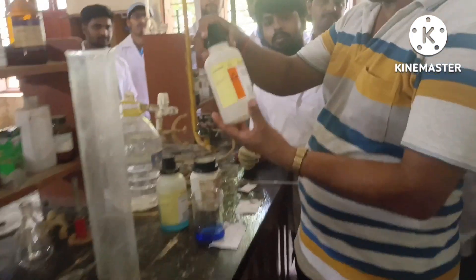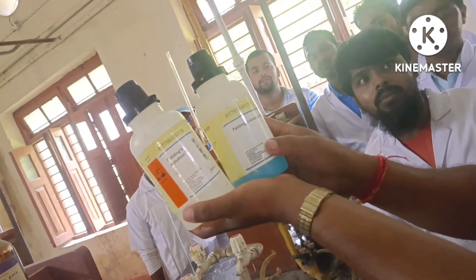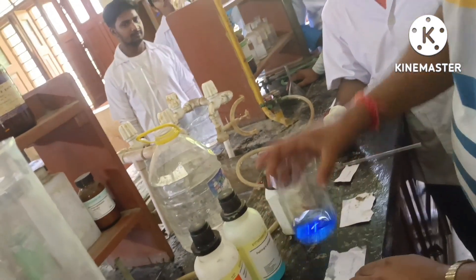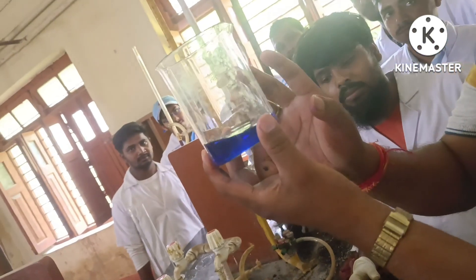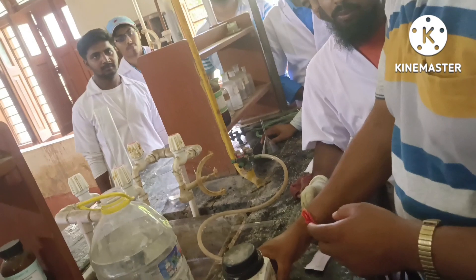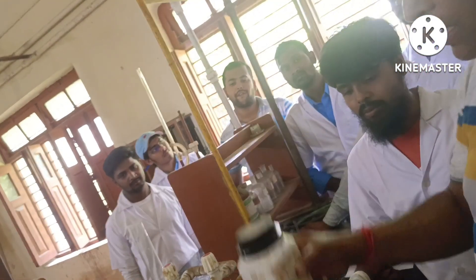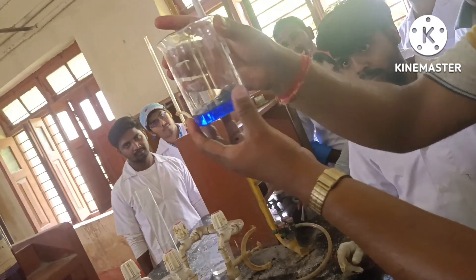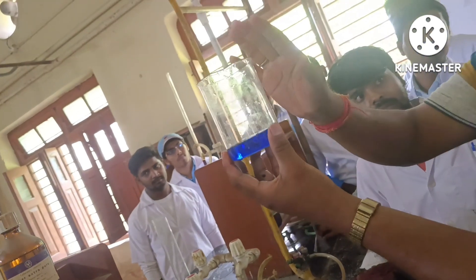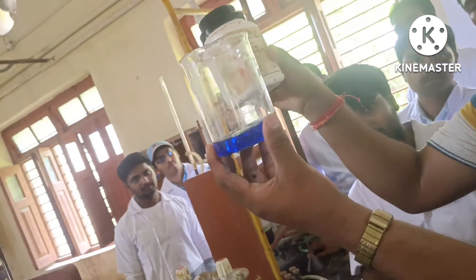We have to prepare Fehling solution — that is Fehling solution A and Fehling solution B. Here we have just added Fehling solution A and Fehling solution B. To this, sodium hydroxide solution is added in this beaker — Fehling solution A, Fehling solution B, with the addition of sodium hydroxide pellets.